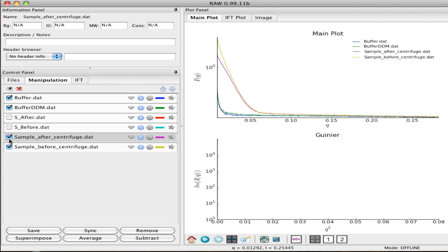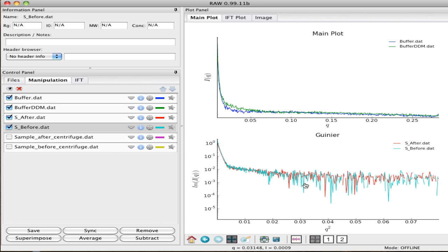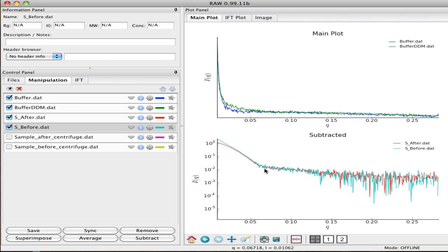I've already done that down here, and so I'm going to go ahead and display those already subtracted curves. Now they don't look particularly interesting. I'm going to make sure I put it in the ordinary log-lin mode. Okay, so here you can see it much more: the aggregated curve just looks a lot like radiation damage. It's not a very straight looking curve. But the real telltale is when we try to do the Guinier analysis.